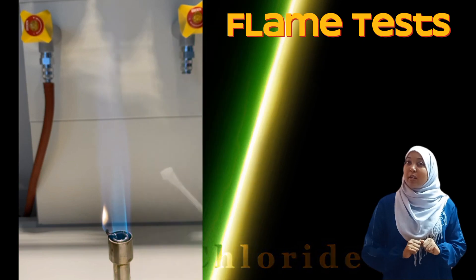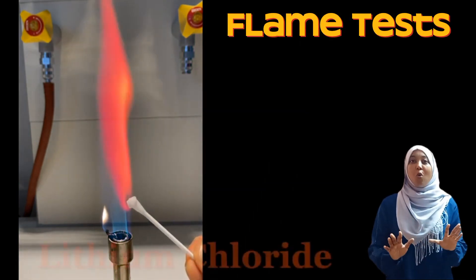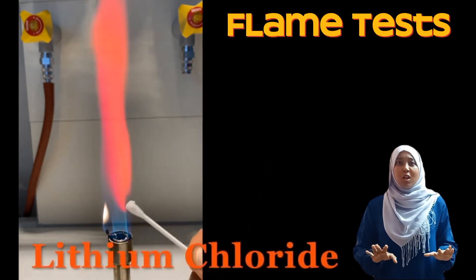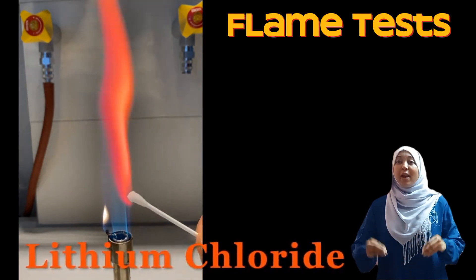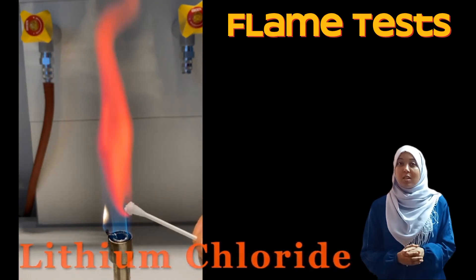Moving on to lithium. Wow, this is so beautiful! Lithium emits a red flame, as seen here.